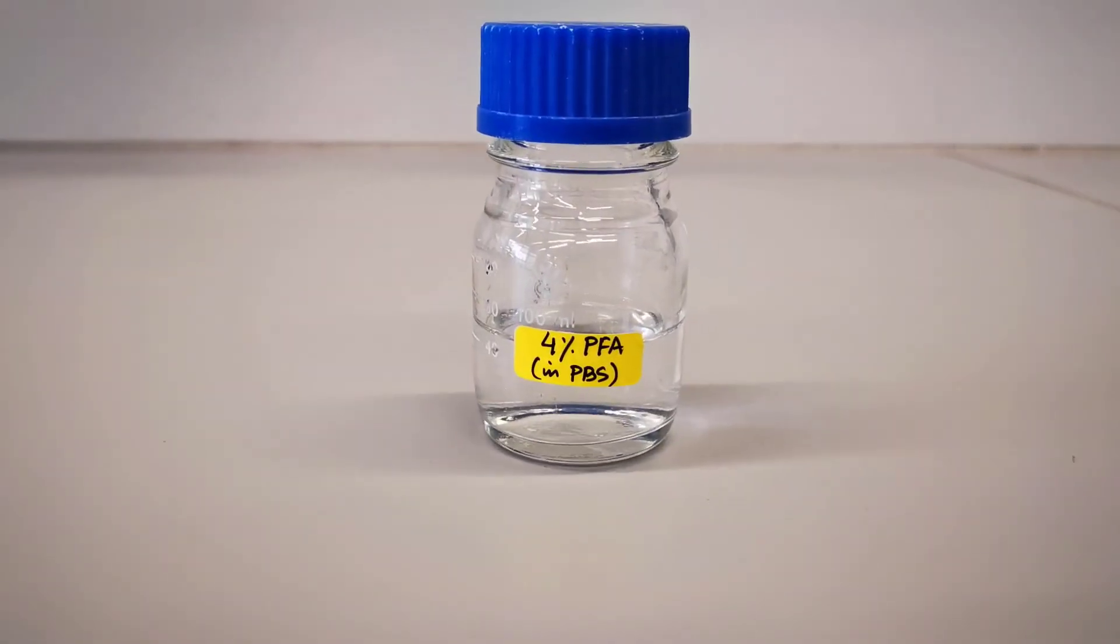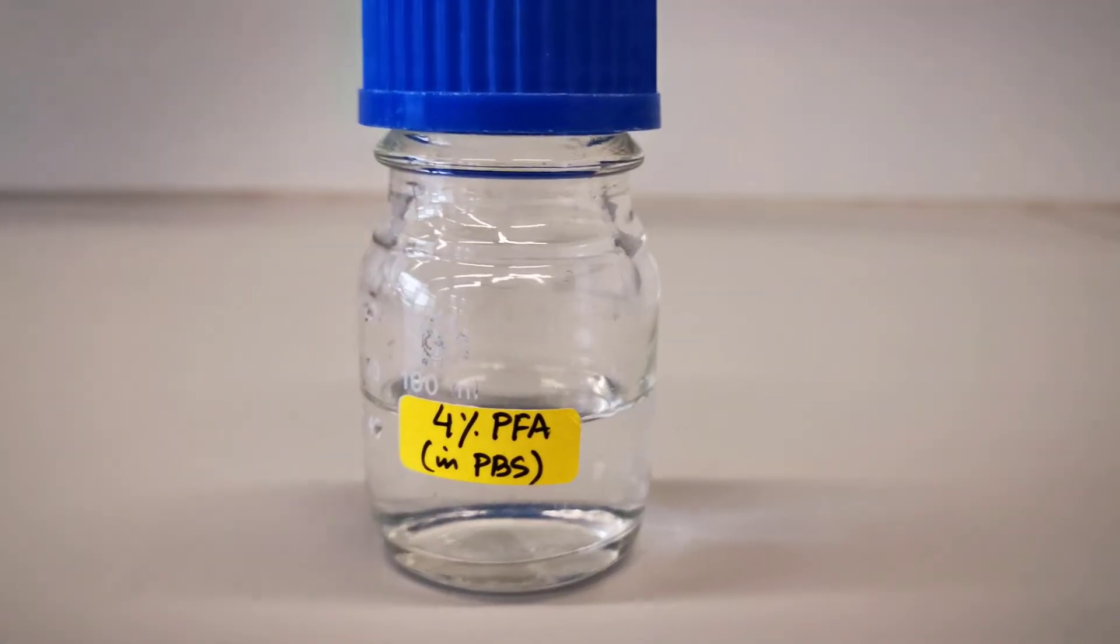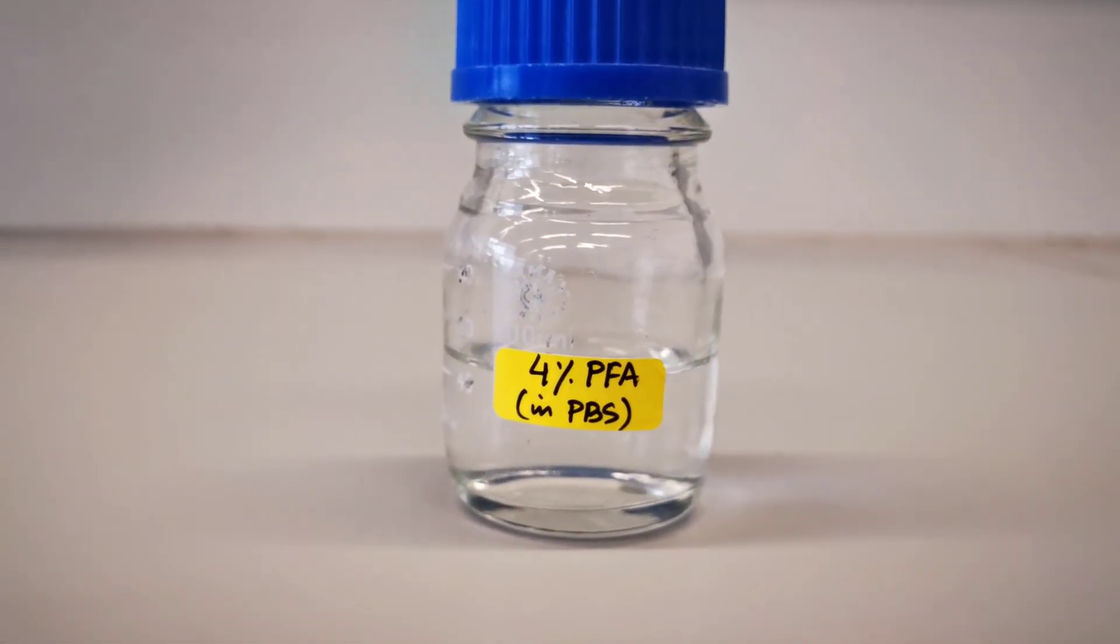This is the final 4% formaldehyde ready to be used to fix nematodes. Please check out our other video on how to fix nematodes.